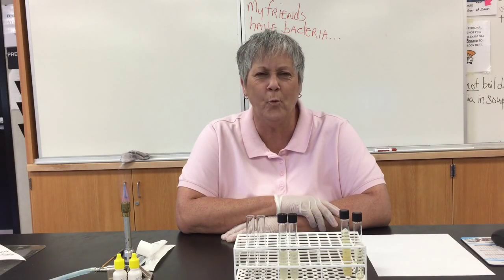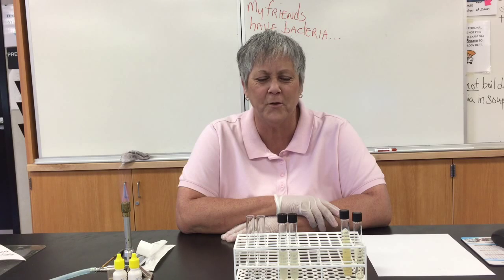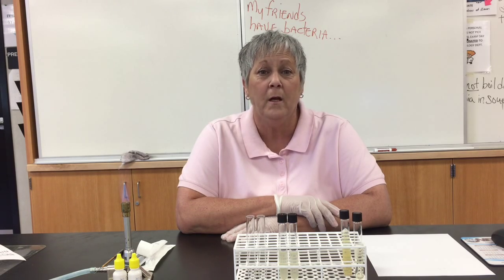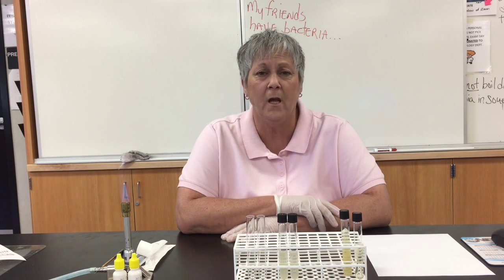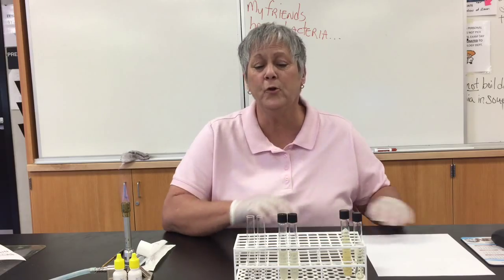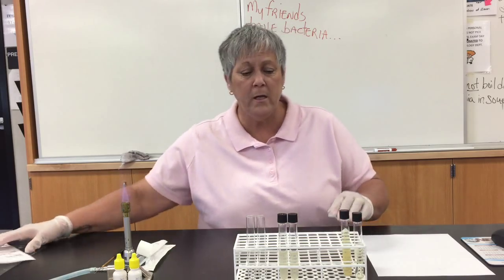Hi students, welcome to One Minute Micro Techniques with Lisa Schimmelt from Crafton Hills College. I want to talk about the nitrate reduction test today, also referred to as anaerobic respiration.